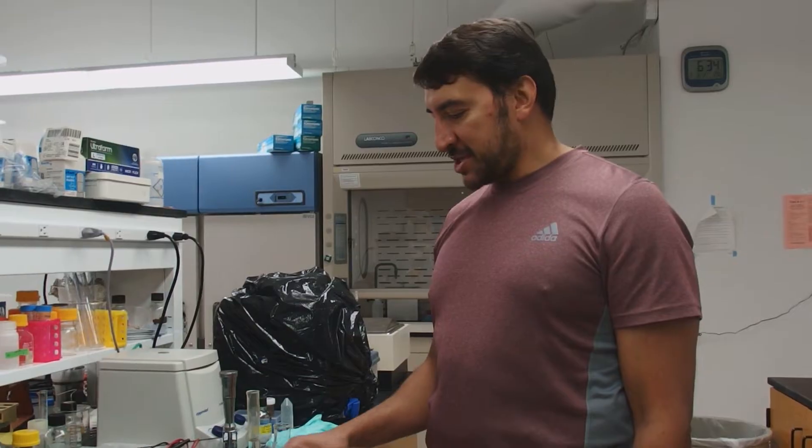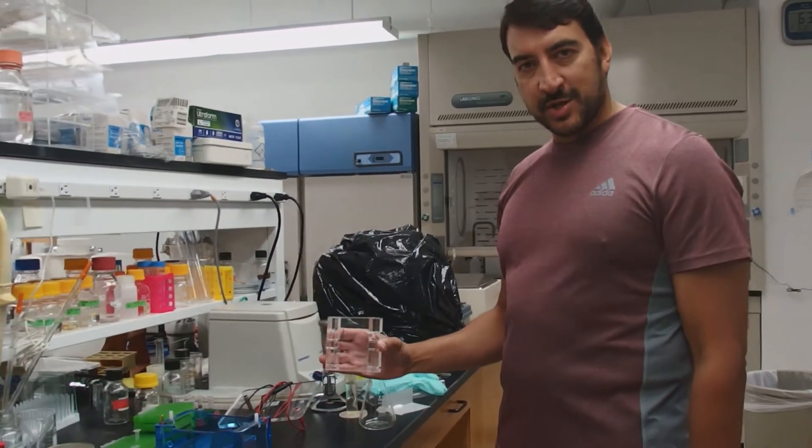I'm going to teach you how to use the OWL electrophoresis system, how to make gels, and how to run gels with this system.